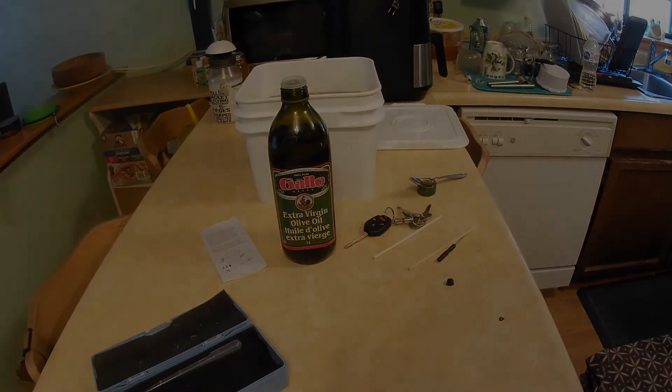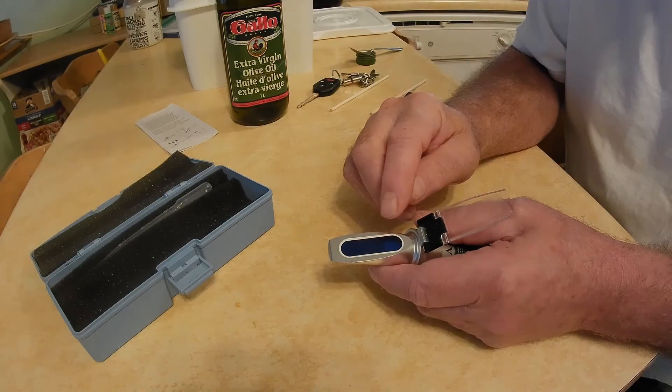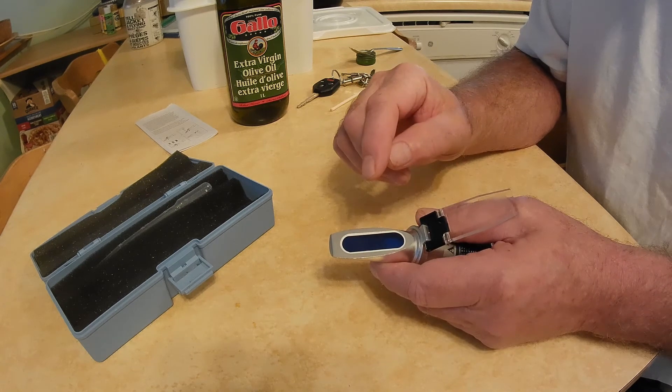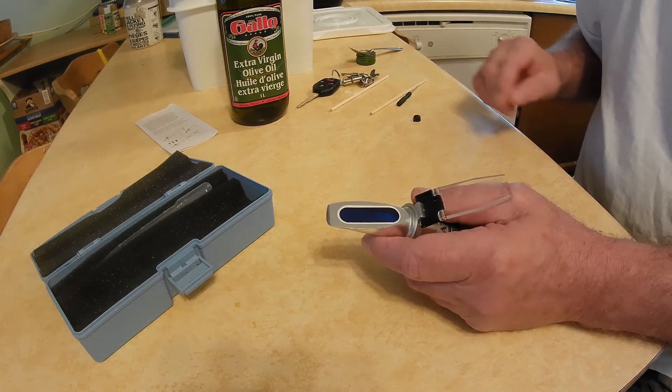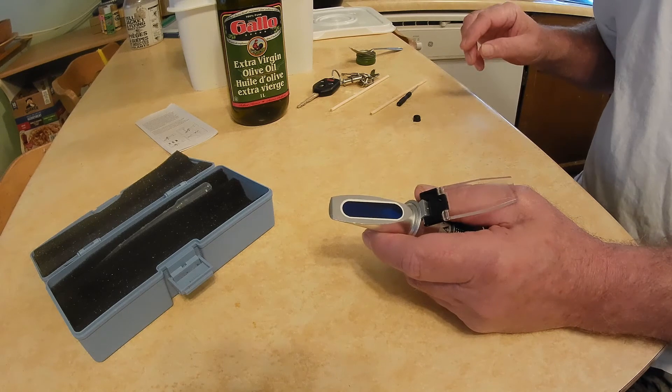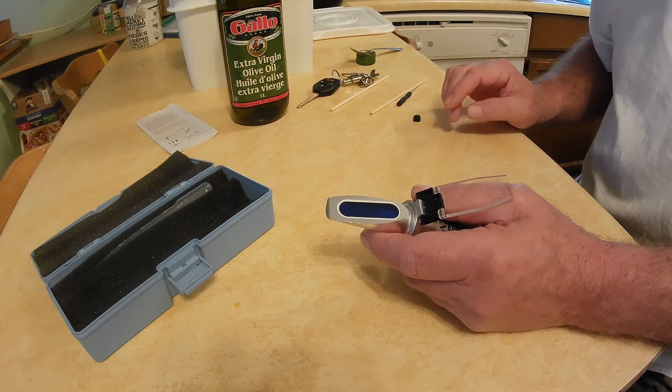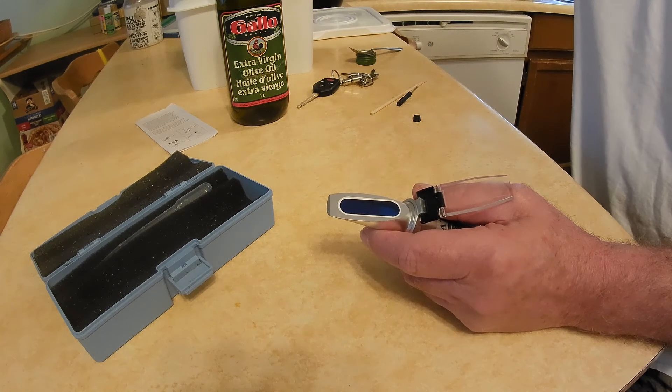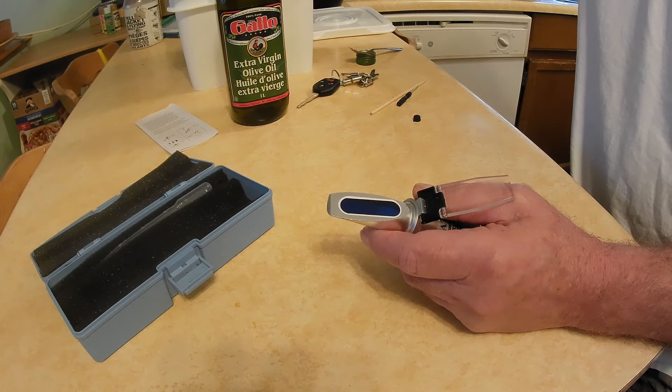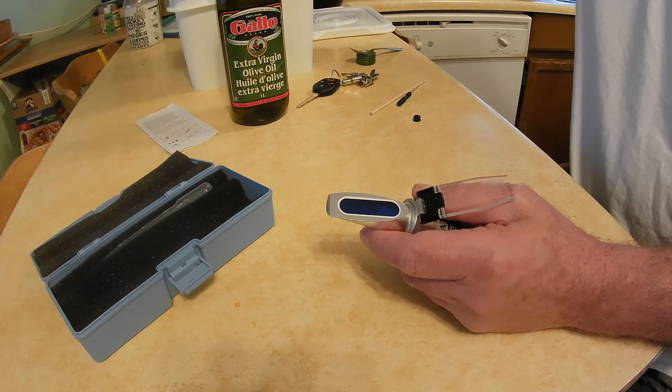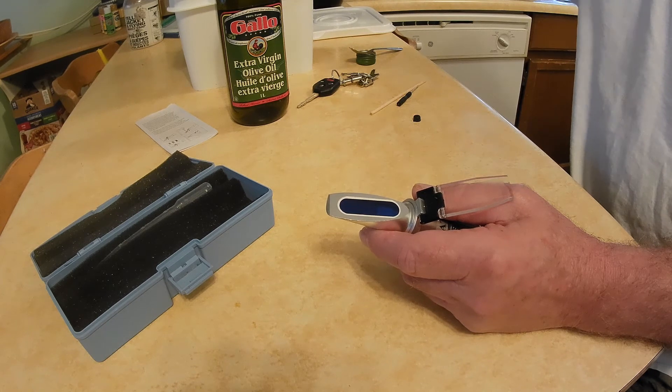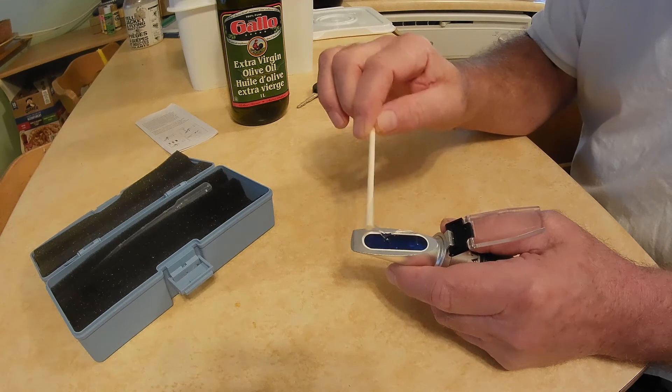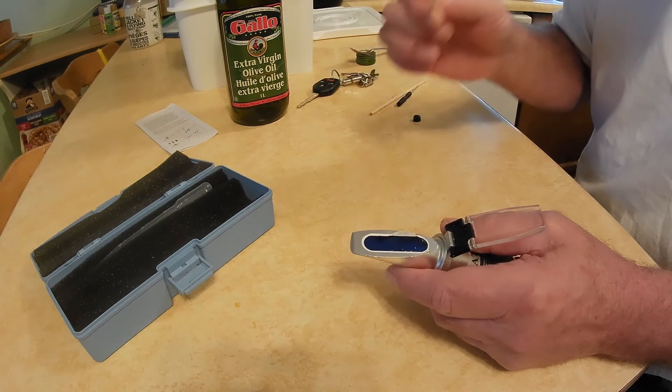We'll be back in a minute. I've cleaned it with some lukewarm soapy water and dried it with an eyeglass towel, something easy to clean your glasses with. Dip my little swizzle stick in with the honey here.